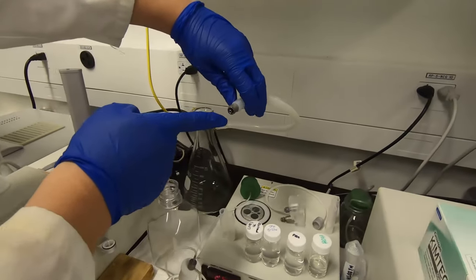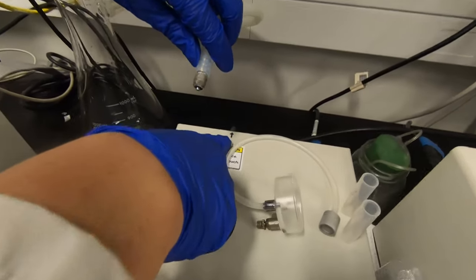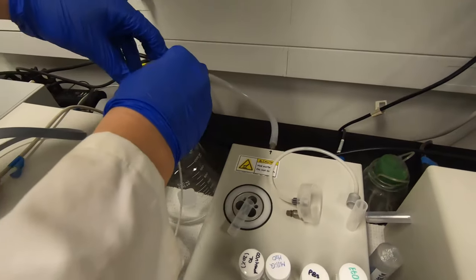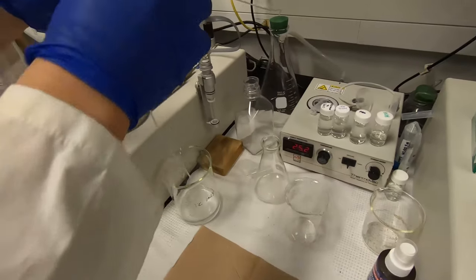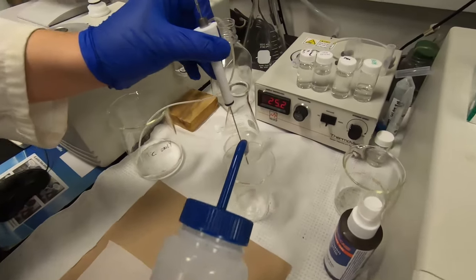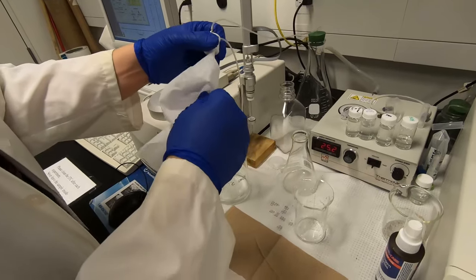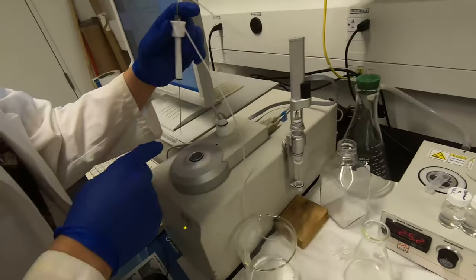Connect this side to the vacuum pump here. Connect this to this, then plug it here. Before putting the needle into the cell, it's better to wash it — if there's some dust or something on the needle, wash and wipe it. Then gently push the needle into the sample cell.